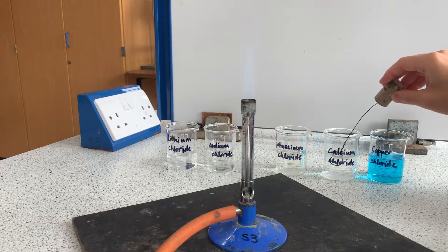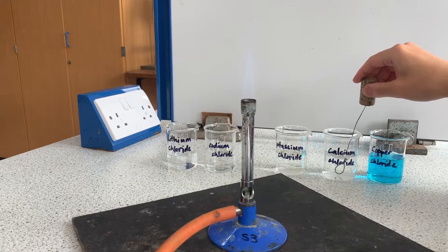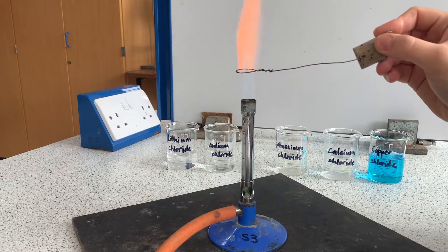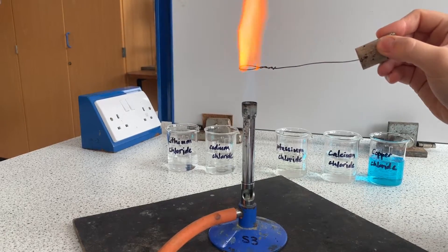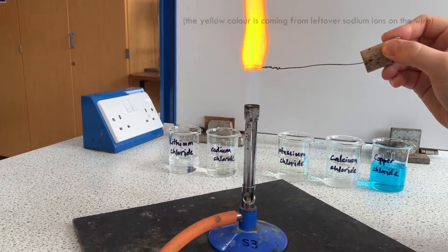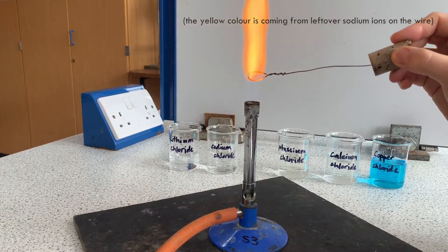Next on to calcium. You'll see calcium ions burn with this vibrant dark orange almost red color, so this one's noted down as red in this practical.